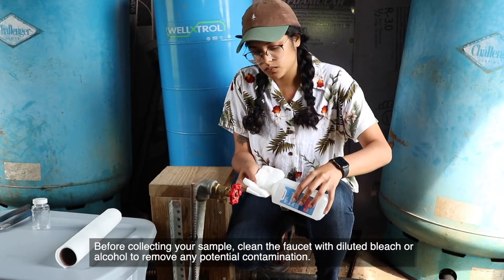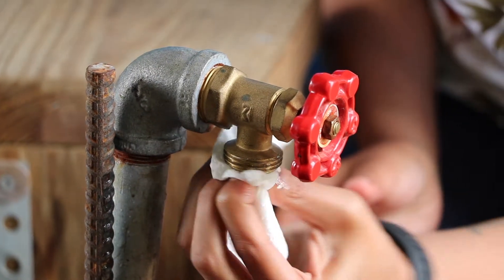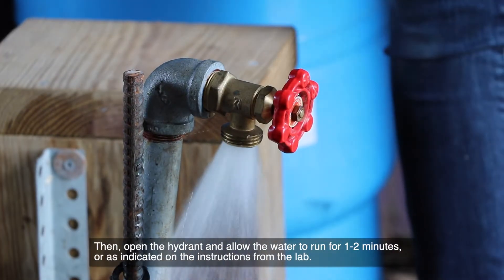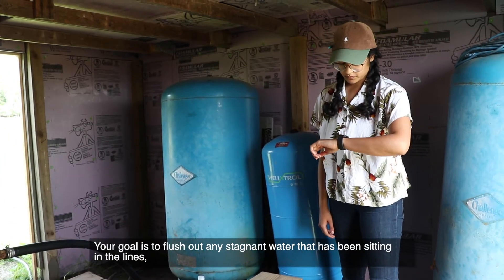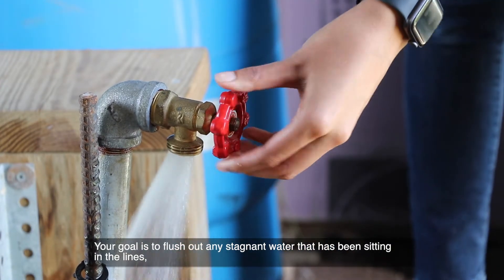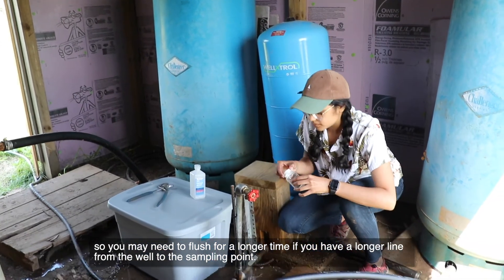Before collecting your sample, clean the faucet with diluted bleach or alcohol to remove any potential contamination. Then open the hydrant and allow the water to run for one or two minutes, or as indicated on the instructions from the lab. Your goal is to flush out any stagnant water that has been sitting in the lines, so you may need to flush for a longer time if you have a longer line from the well to the sampling point.